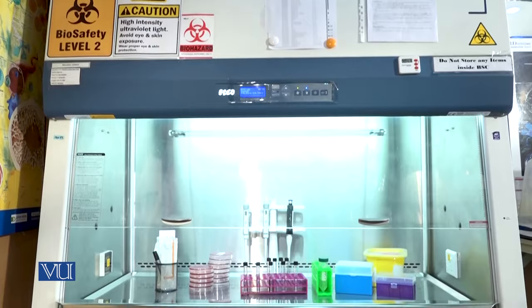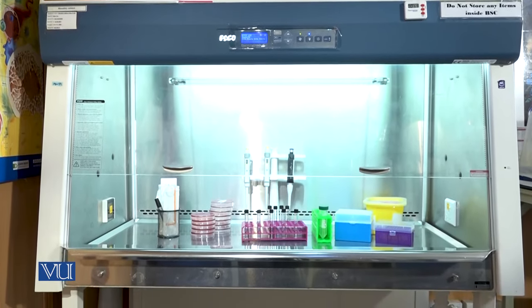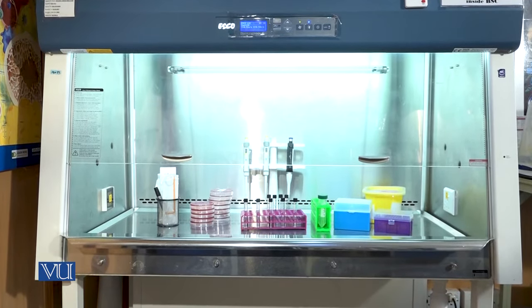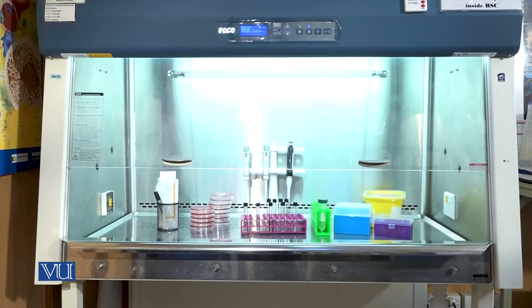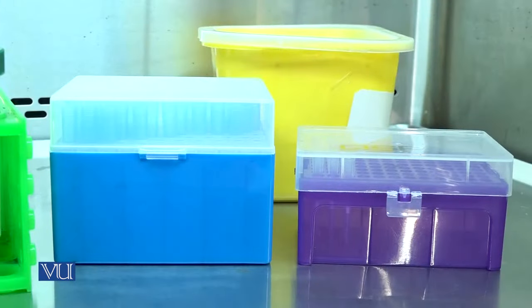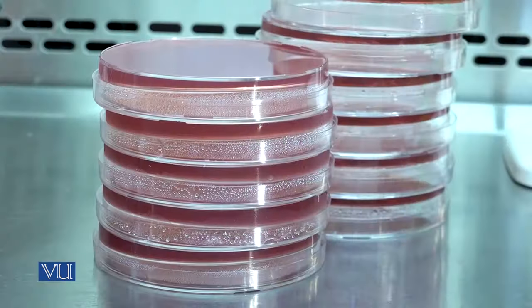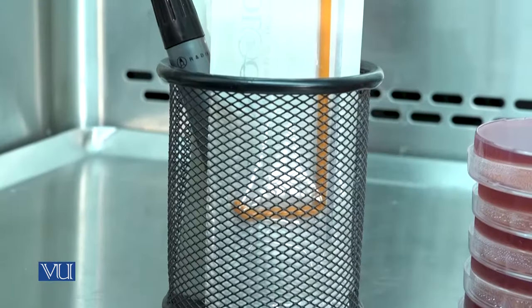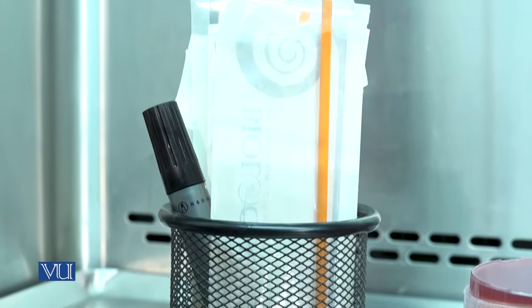It is preferable to make tenfold serial dilution of the bacterial culture inside a safety cabinet to avoid contamination. For making serial dilutions you would require bacterial broth sample, pipette tips, glass tubes, bacterial culture plates, and sterile disposable bacterial spreader.